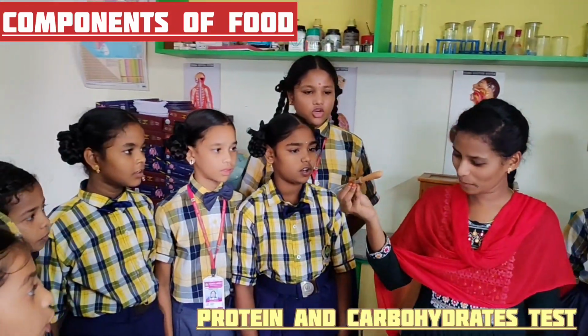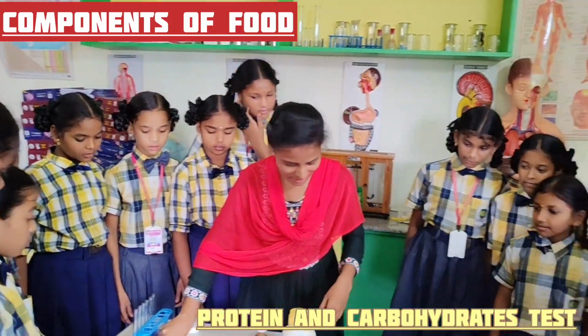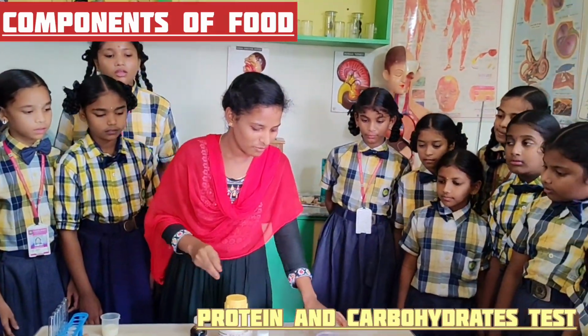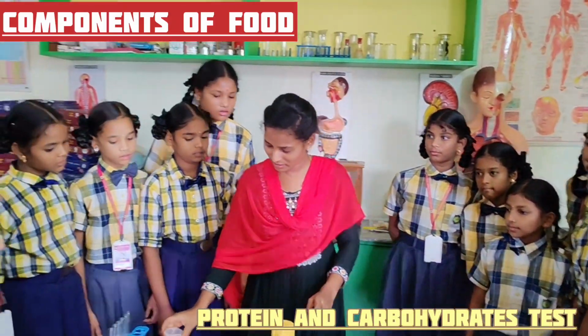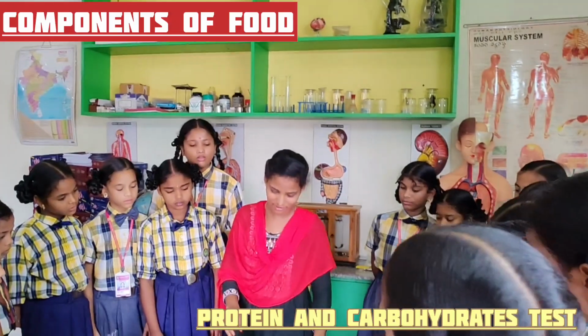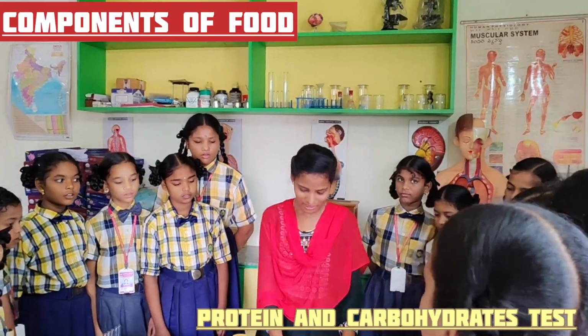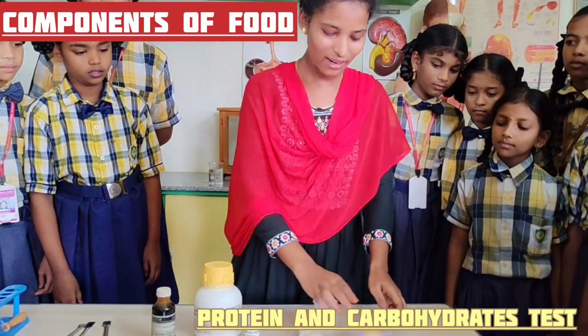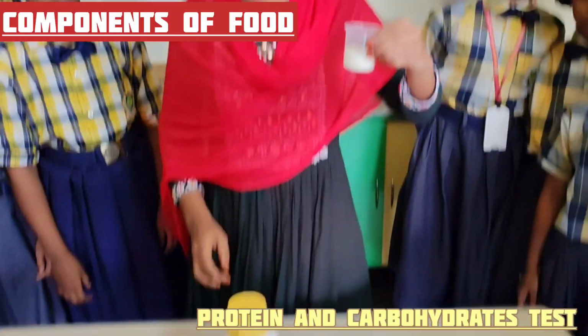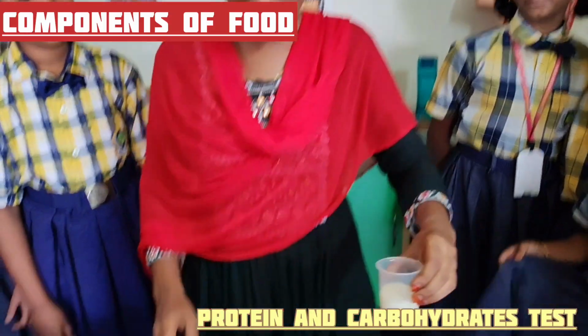Okay? This is a dropper. First, we have to find out whether the food material contains protein or not, whether the food material contains carbohydrate or not. We have taken rice, cooked rice, bread, potato pieces and milk. This is raw milk. Okay?